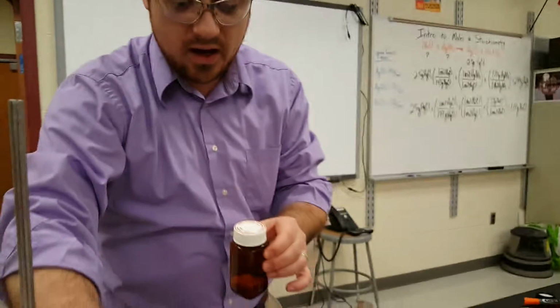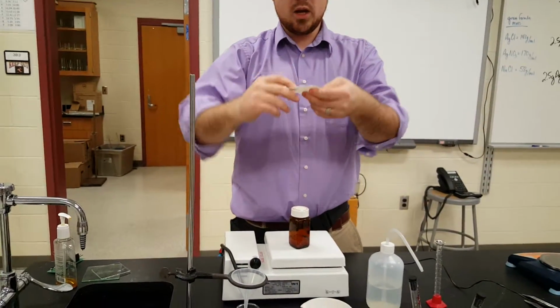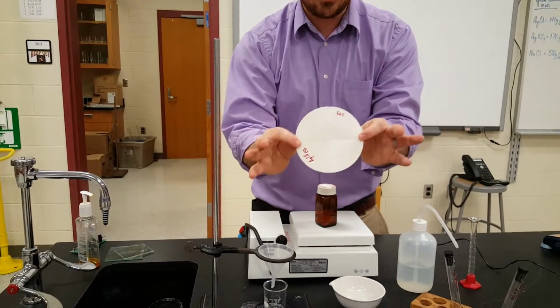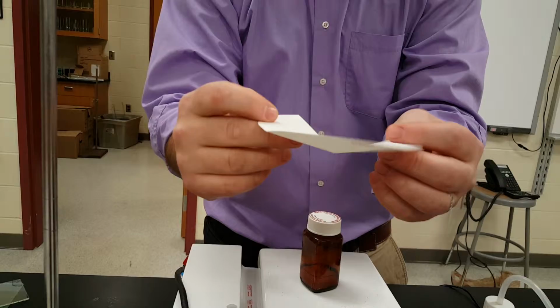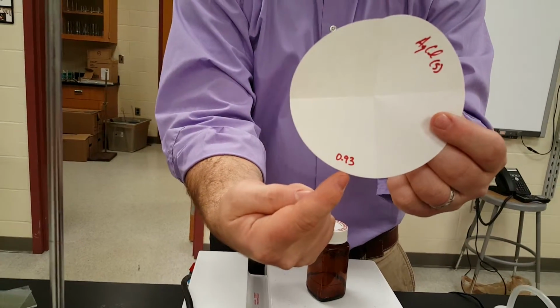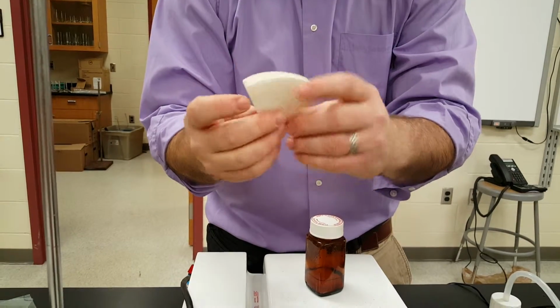Now I have to do a filtration. Okay. Do you want me to turn off the lights for the filtration? We can get it started in the regular light. We're going to turn out the light in a minute. Now notice, I have another filter paper. I've written the mass of this on there. Why would I do that, Mr. Milks? Because tomorrow when we mass this, you're going to mass it on the paper.